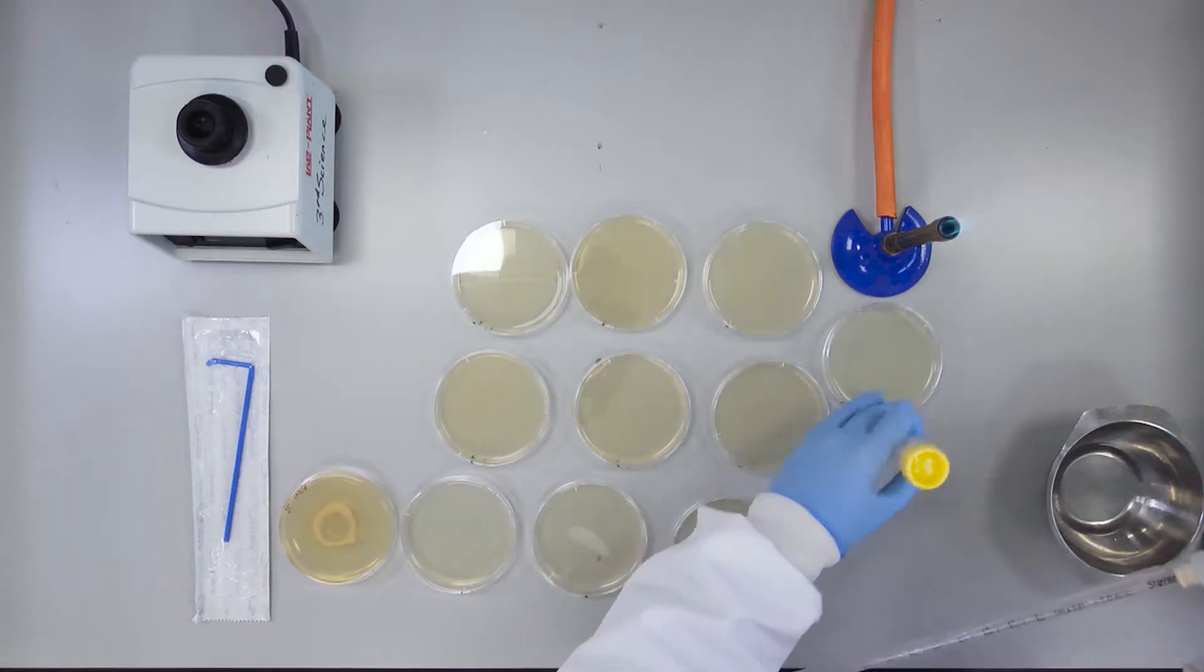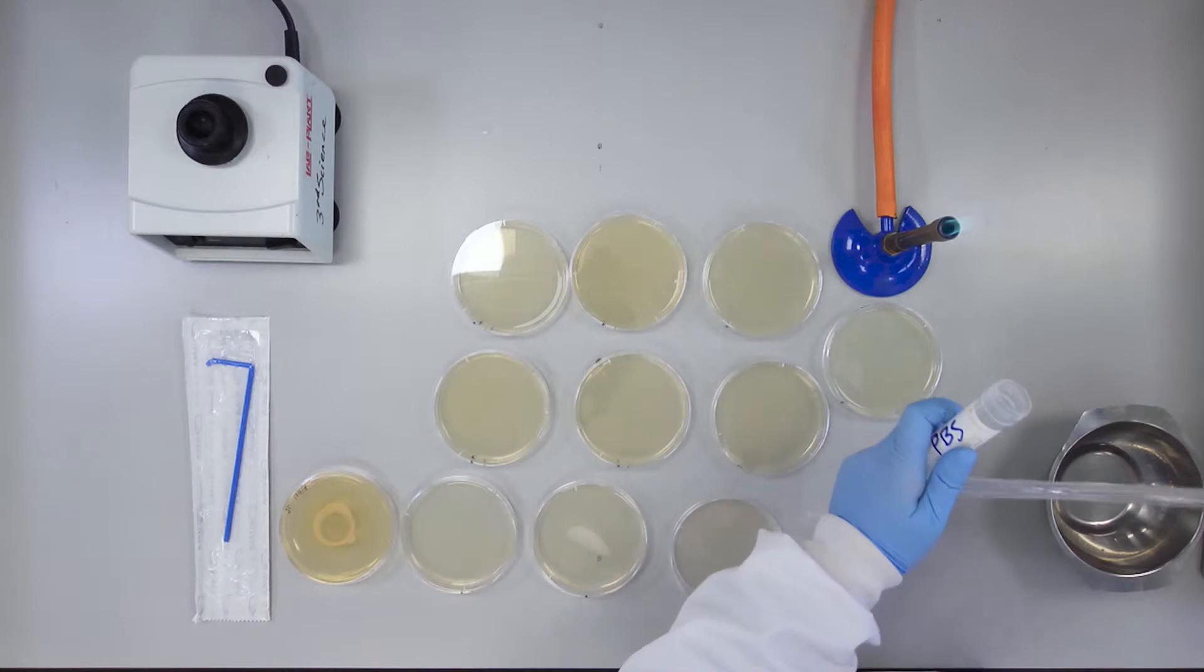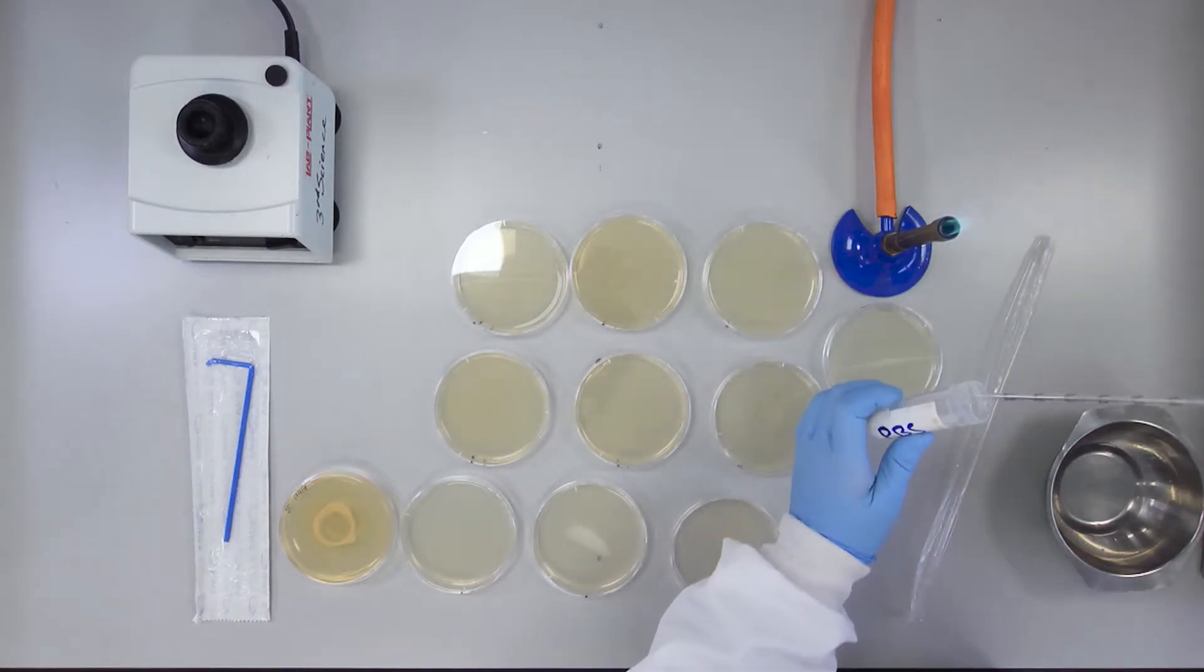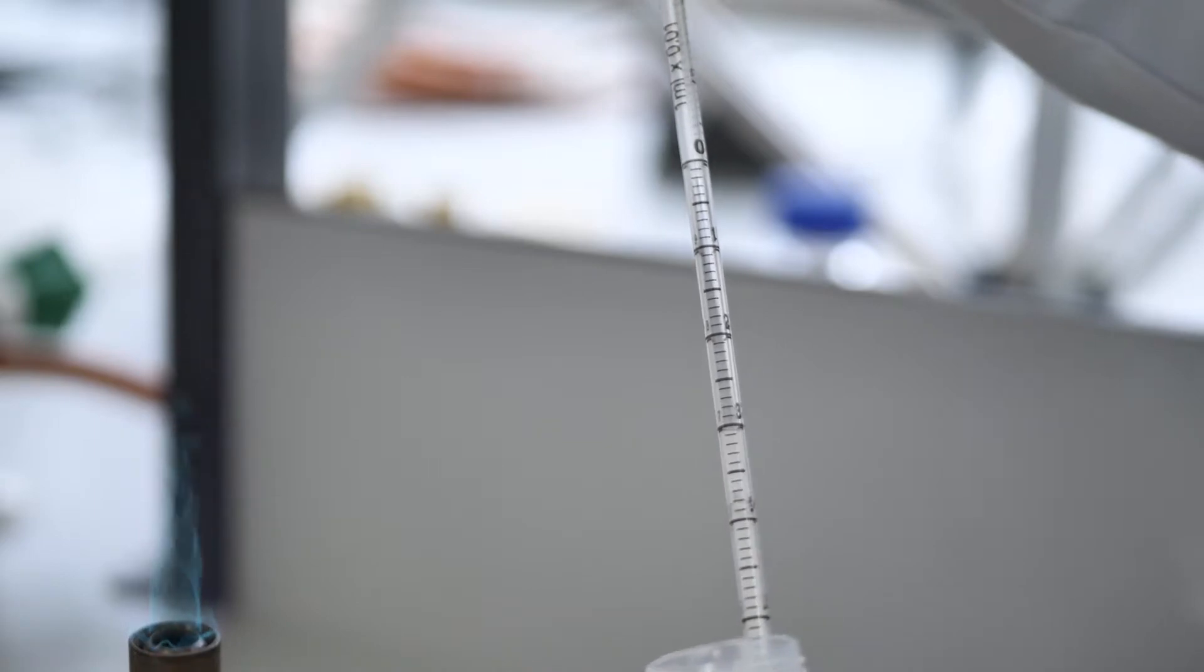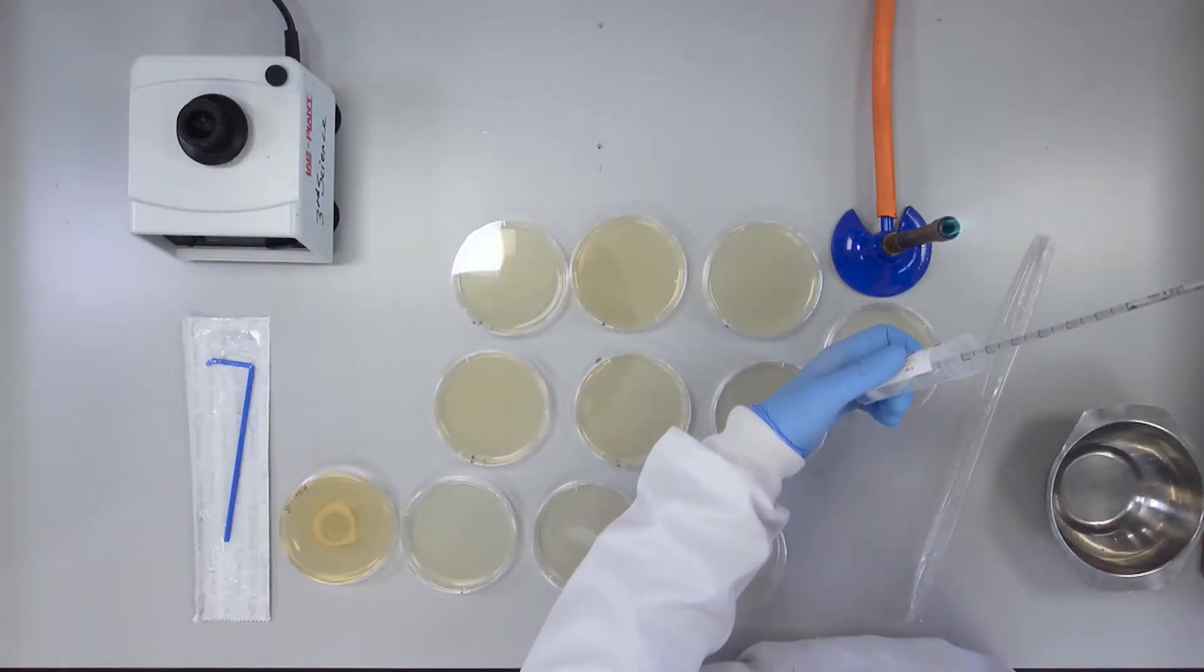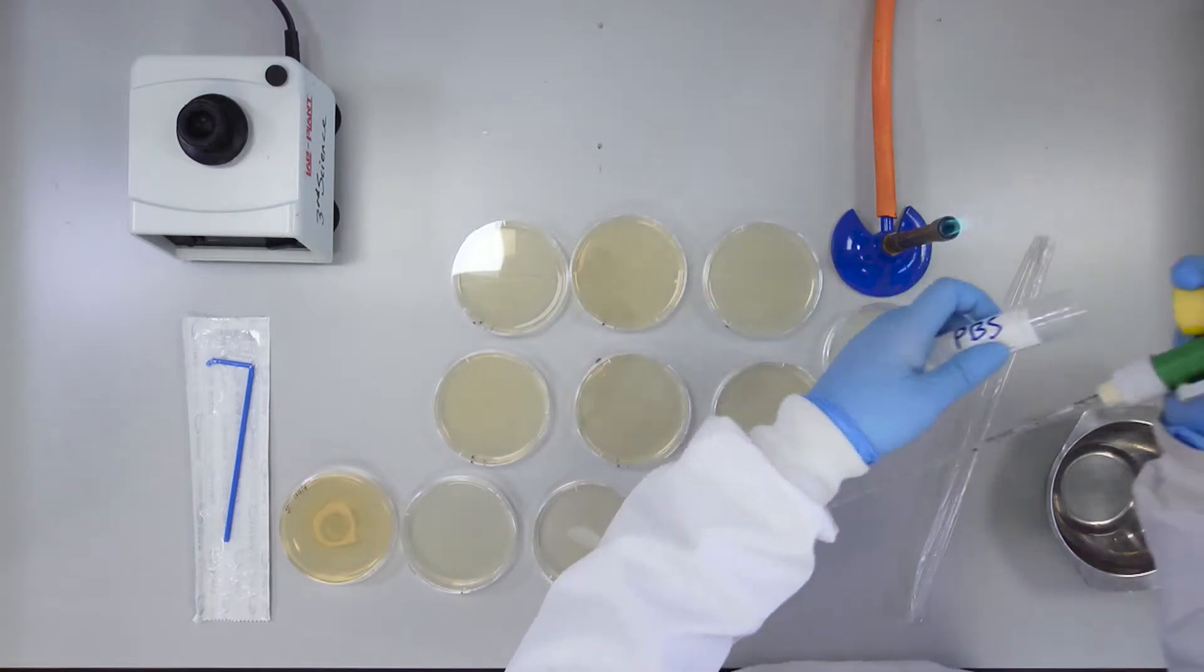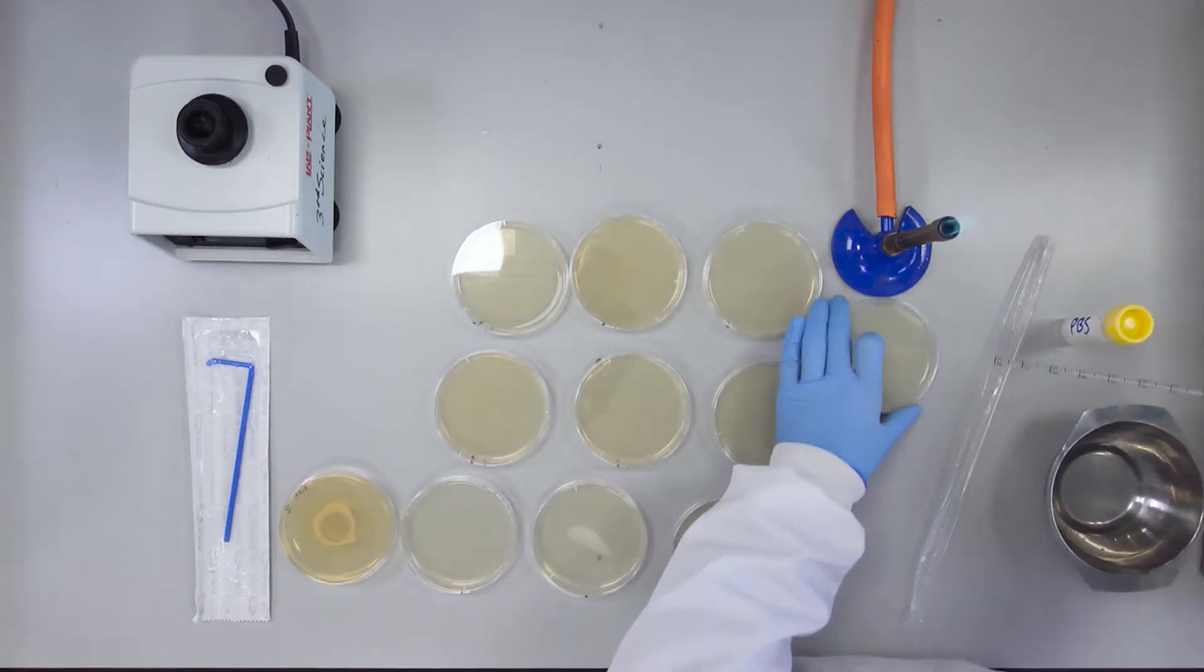Using a 1 milliliter pipette, transfer 100 microliter volumes to the surface of 10 TSA plates containing tetracycline and ampicillin.